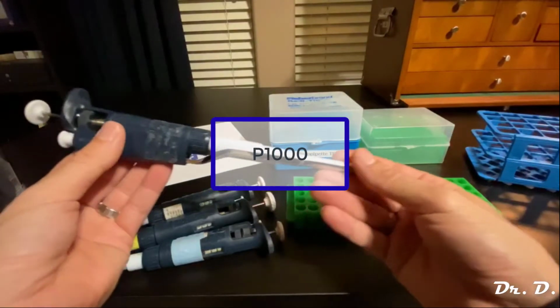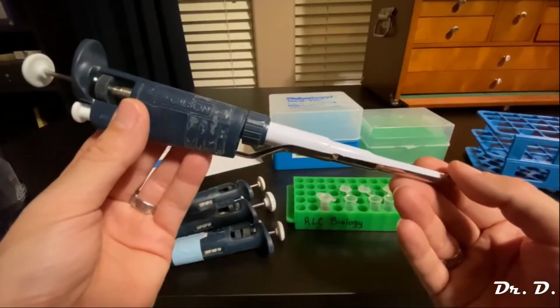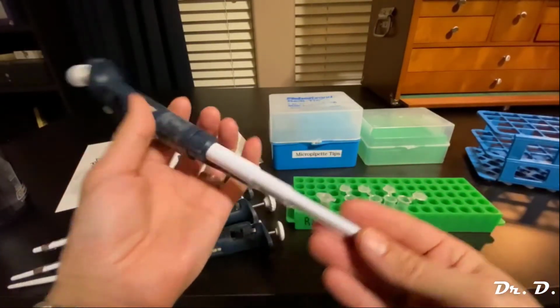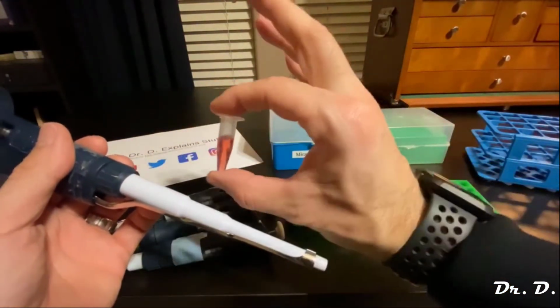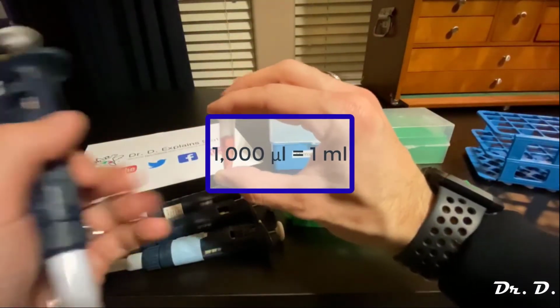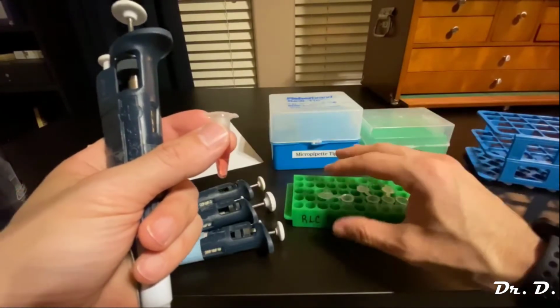What that tells me is that this pipetteman works to a maximum of 1,000 microliters. And again, what's 1,000 microliters? I just told you. 1,000 microliters means exactly this amount right here, a milliliter. So what did I say I want to transfer into this tube? I wanted to transfer 500 microliters, right?